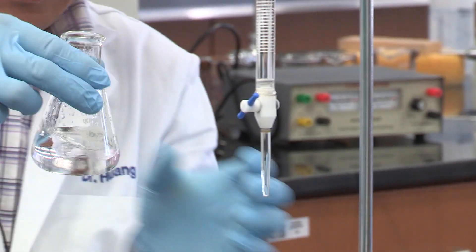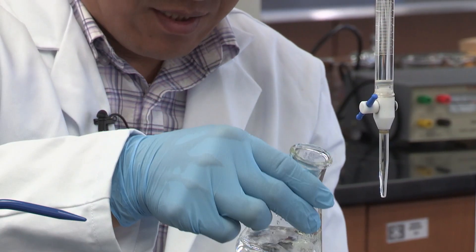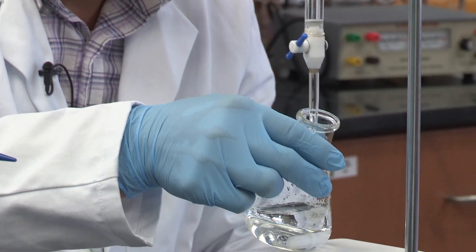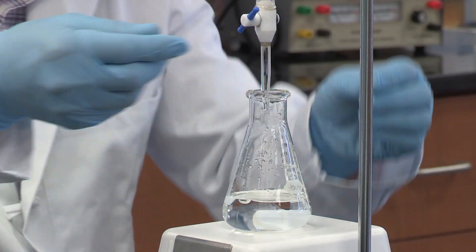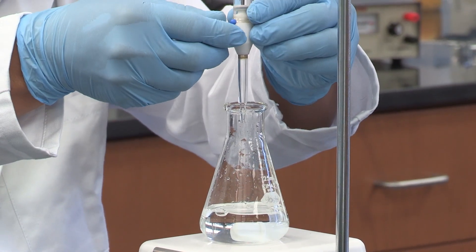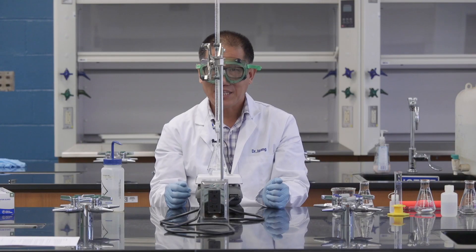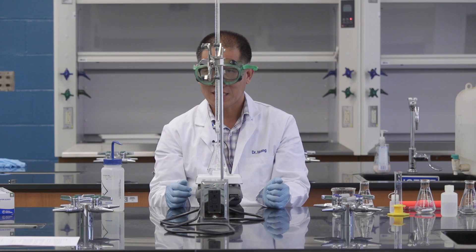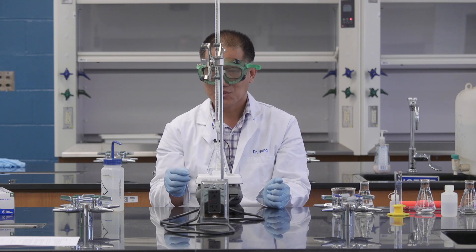You can say, right now I need to add half a drop each time. You may wonder how to add less than a drop. Look at what I'm doing.